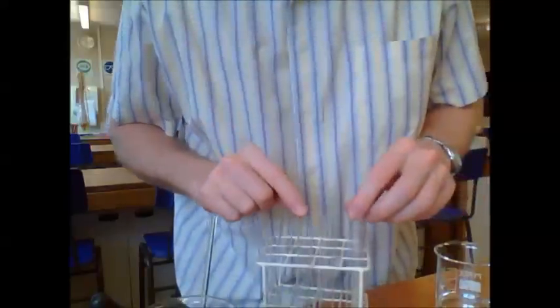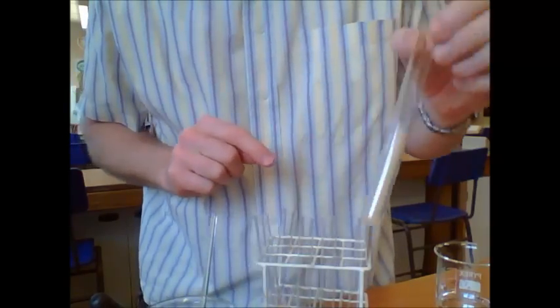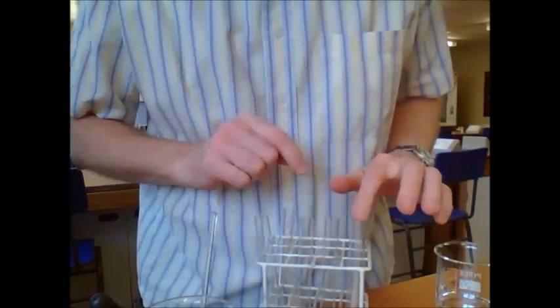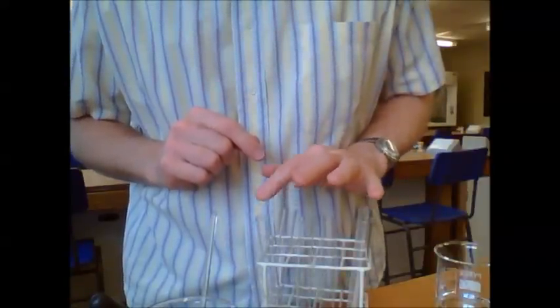We'll repeat that for each of the temperatures. So we're going to have one on ice, one at 20 degrees, 30 degrees, 40 degrees, and 50 degrees.